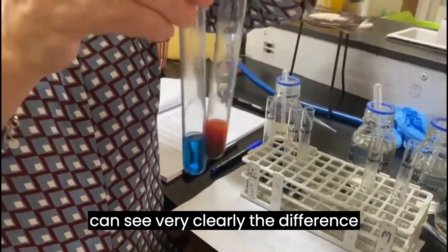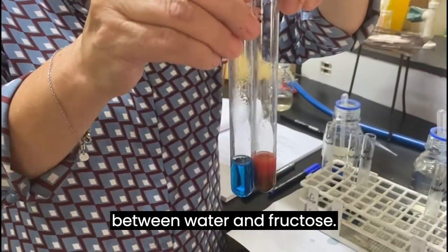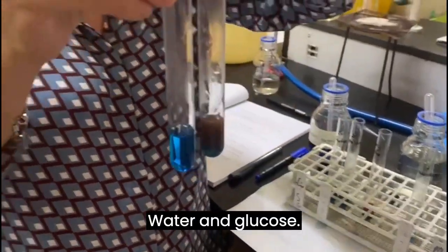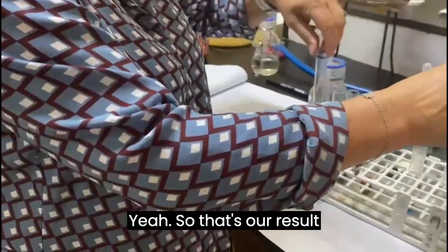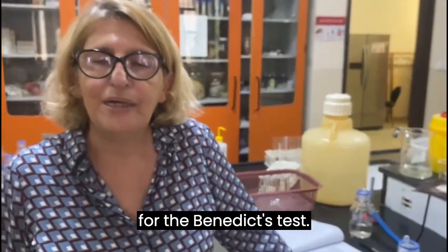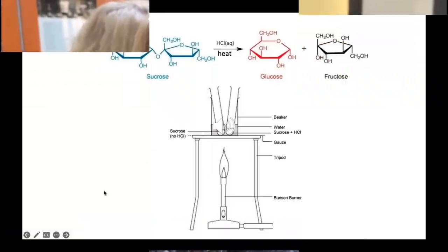While you can see very clearly the difference between water and fructose, water and glucose, yeah? So that's our result for the Benedict's test.